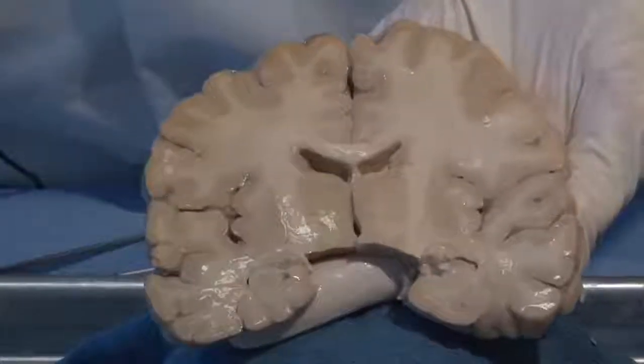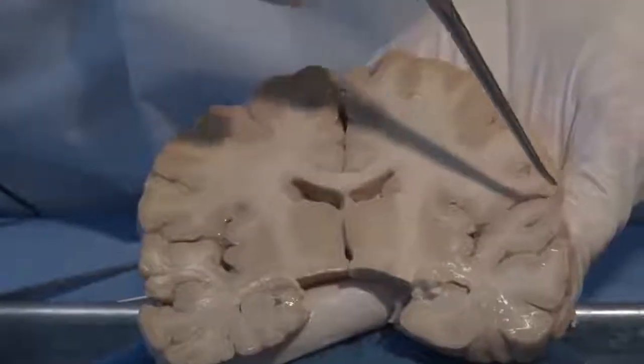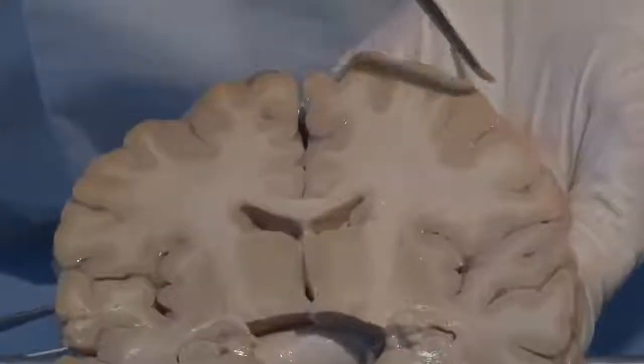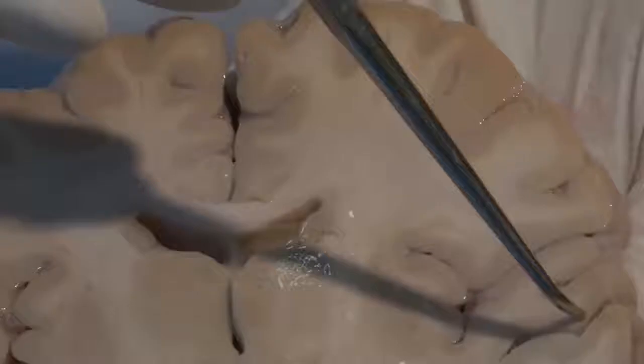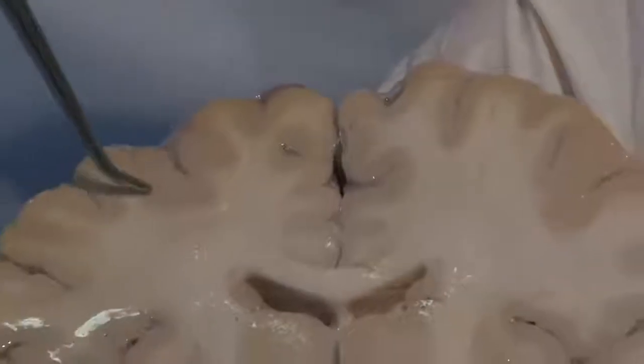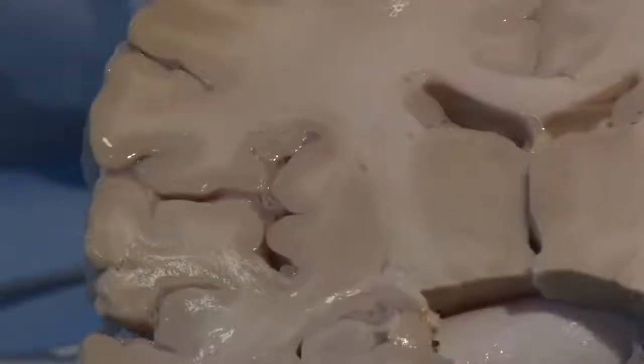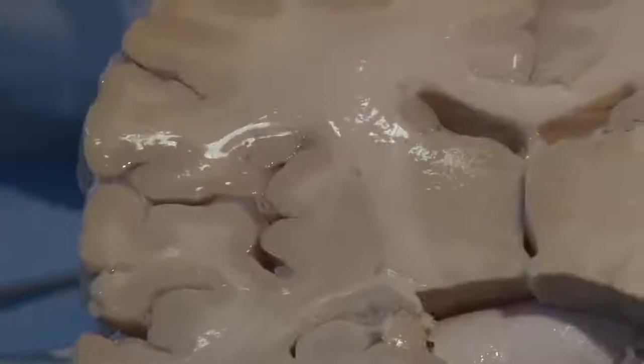We'll deal with these in more detail, but right now you can see that those gyri that we were looking at and the sulci, the dips in between, can be easily distinguished. And the gyri are covered with a nice layer, beige in color, and that is your gray matter, as we say, of the cerebral cortex. Maybe we should have called it beige matter.